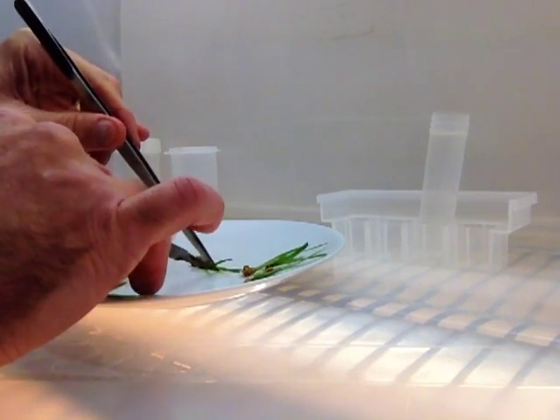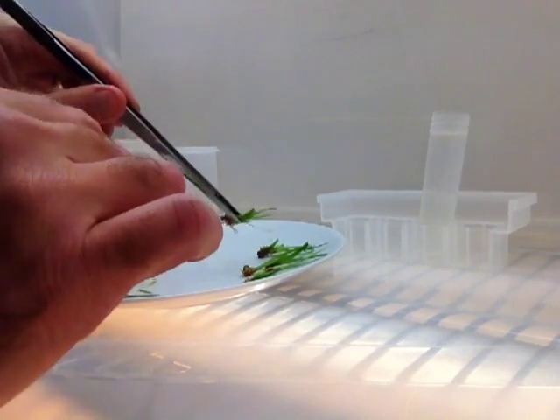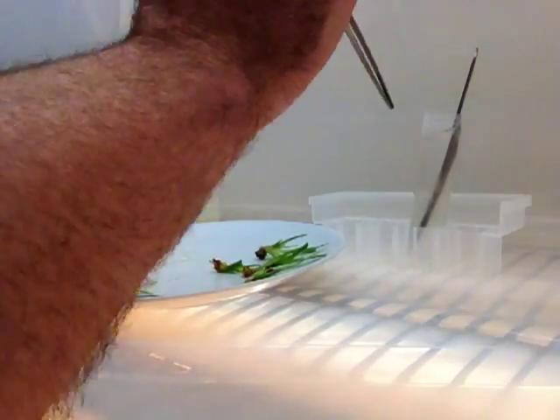See why it's good to have sharp blades. Tool goes back in the alcohol. I'm going to go ahead and dip my forceps in alcohol too.